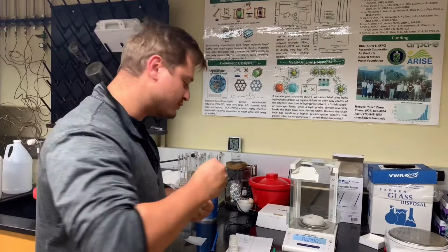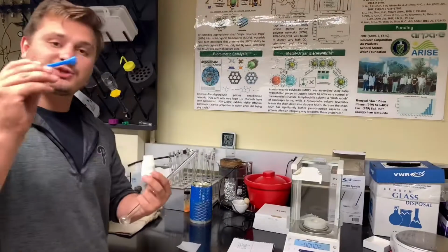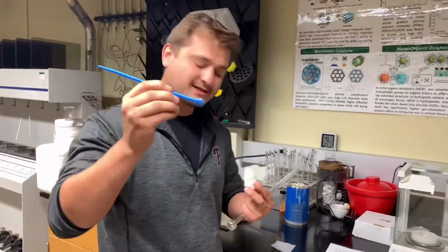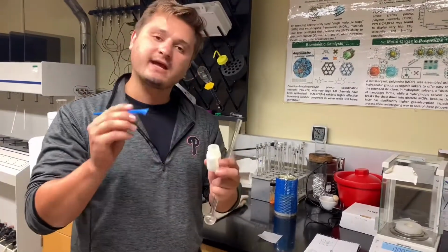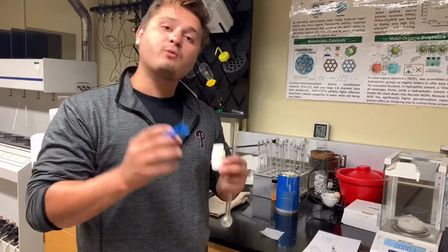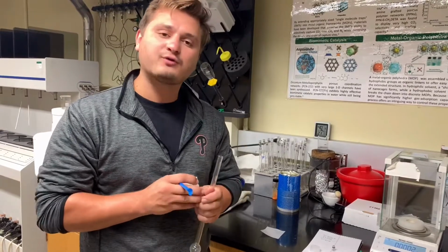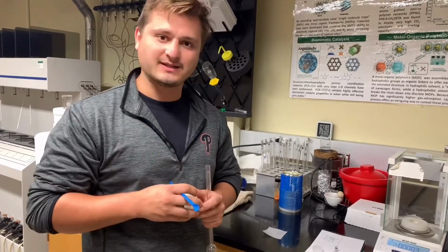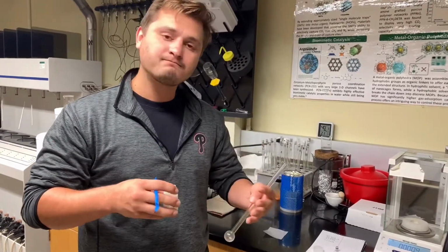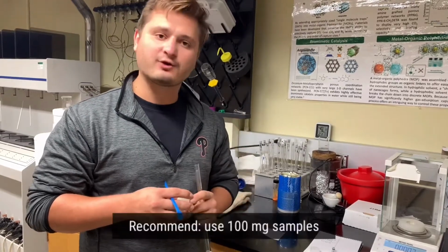So we're going to take the sample tube off, and then we're going to open our sample, and either using a spatula, whether it's metal, glass, plastic, or by putting our sample onto a piece of weigh paper, we want to add our sample into the tube, and we want to add approximately 100 milligrams. 100 milligrams is the ideal amount, 0.100 grams is the ideal amount of sample that we should use for all of our measurements. That ensures not too long of time is used for each analysis, but we have enough sample that the error on the analysis is minimized. So it's best case, use 100 milligrams of sample.